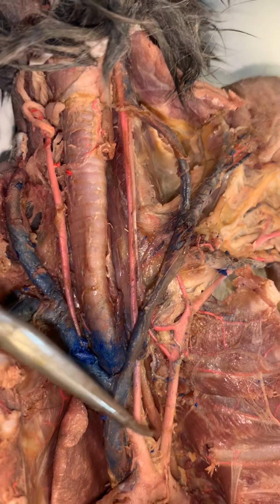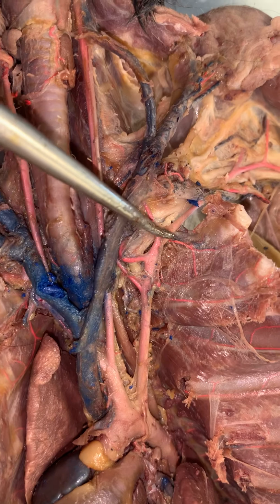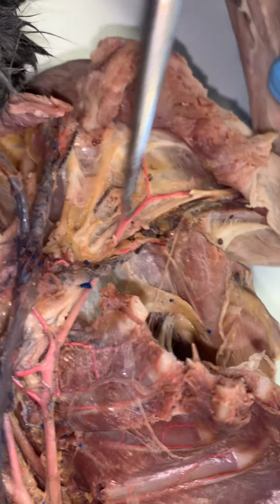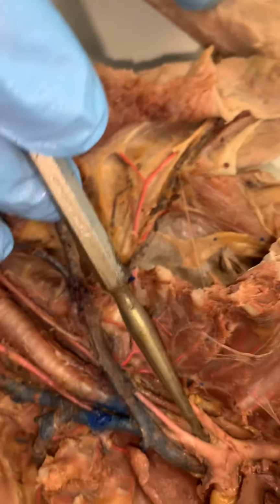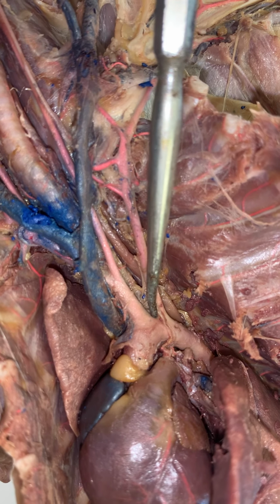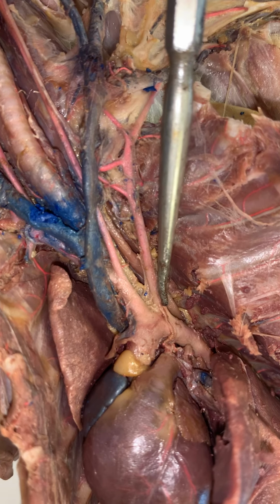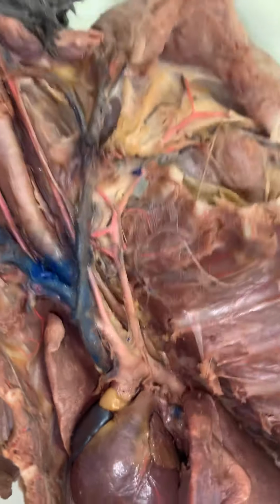And then over on this side, we have the left subclavian coming around, axillary, and then the brachial artery here. Now this is a little bit different in humans, because in humans, the left common carotid has its own exit right here. So on us, we have a brachiocephalic, a left common carotid, and the left subclavian. But with the cat, we only have the two right here. All right, so let's take a look a little bit lower.